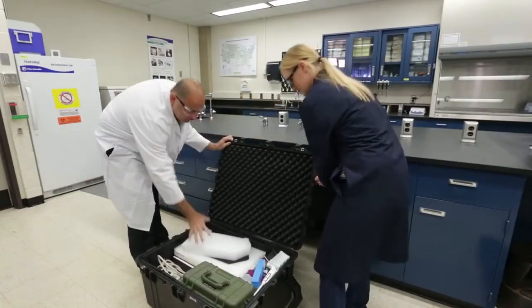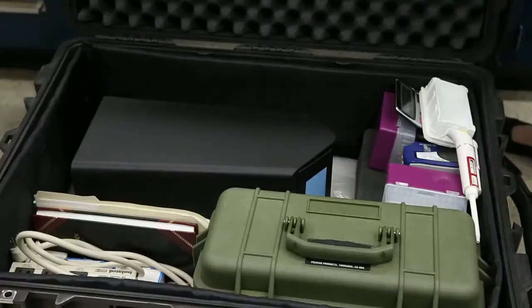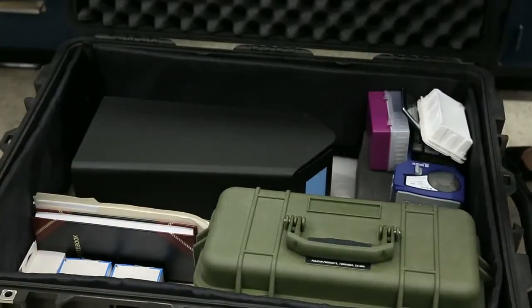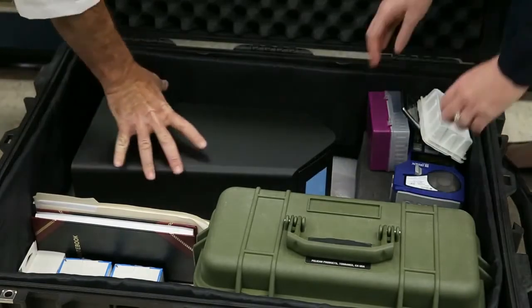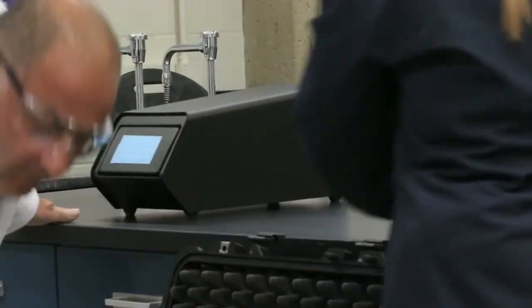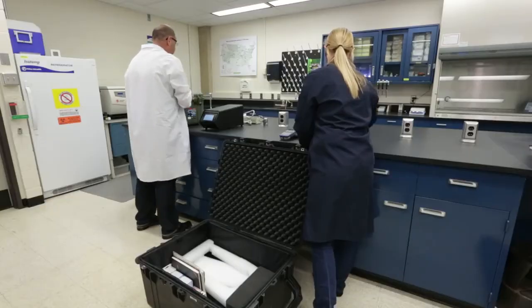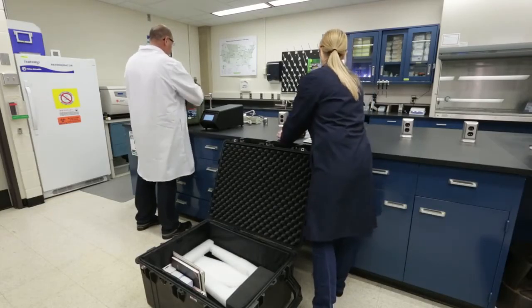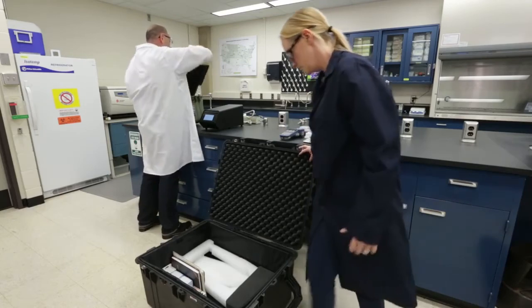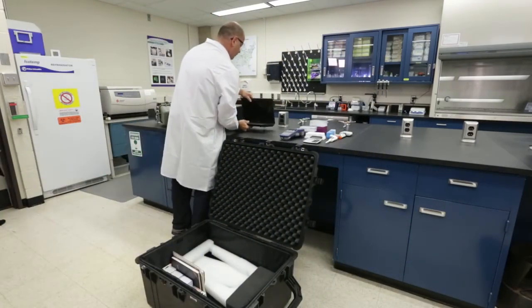The analytical equipment, software, and hardware can be assembled as a mobile unit. Such a kit can be rapidly deployed to sites where cyanobacteria blooms are occurring and ELISA testing is needed. The analyst operating a mobile unit will follow the same procedures that were demonstrated in this training. To determine each analyst's capability to meet the appropriate qualifiers, QC acceptance, and method reporting limits, please refer to the Ohio EPA method.